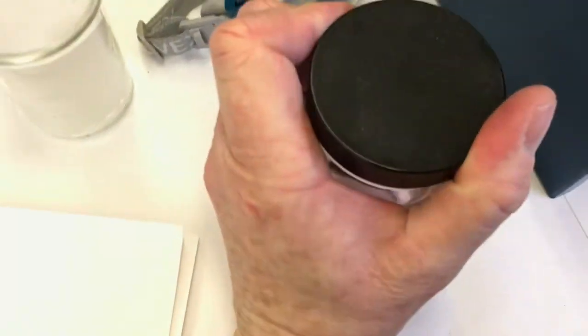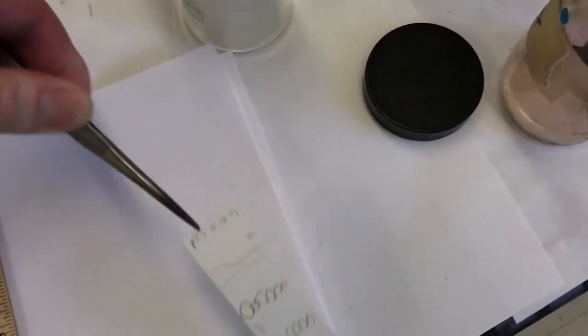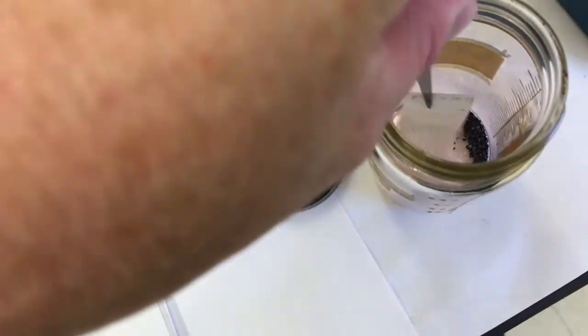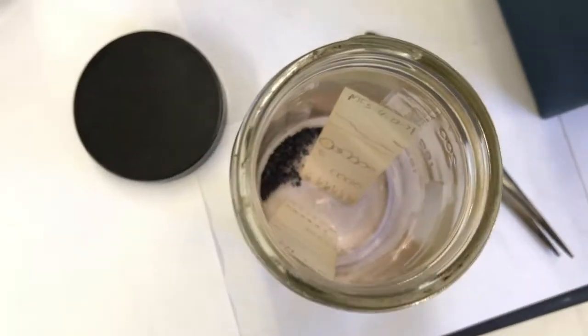And this is another easy thing you can do. You just open up the iodine chamber and put your TLC plate in there. And stick it in there. It doesn't matter which way it goes, but I want it to go this way. There we go. And then I'll stick them both in there, why not? So I've got my 2 TLC plates in the iodine chamber.